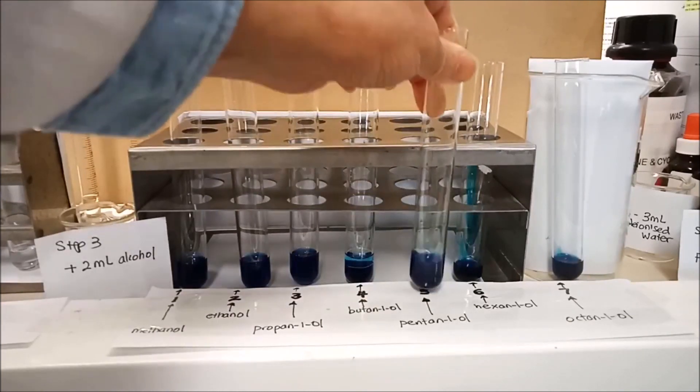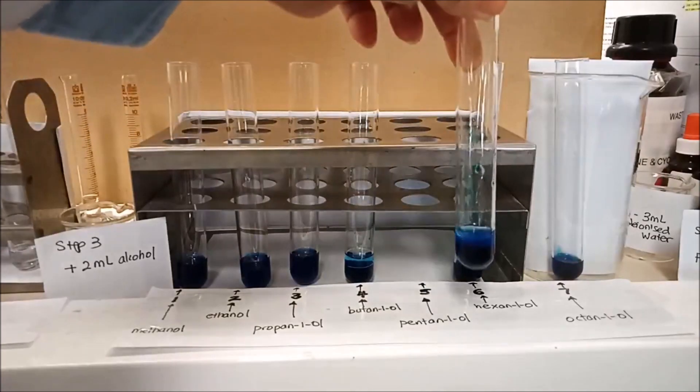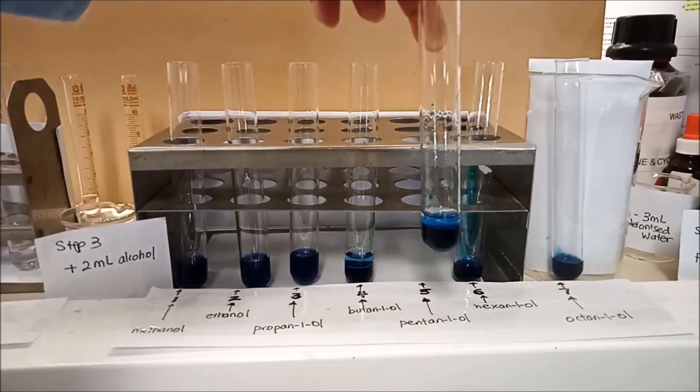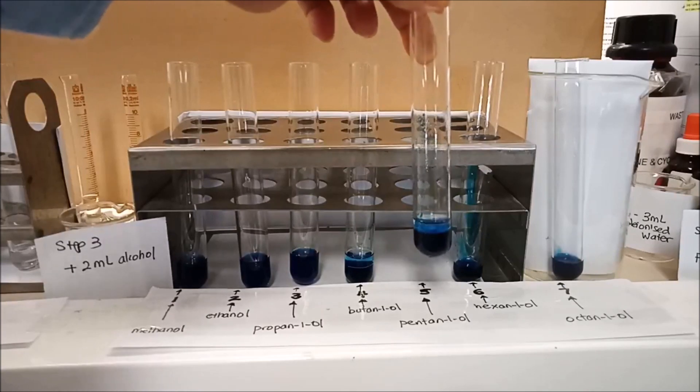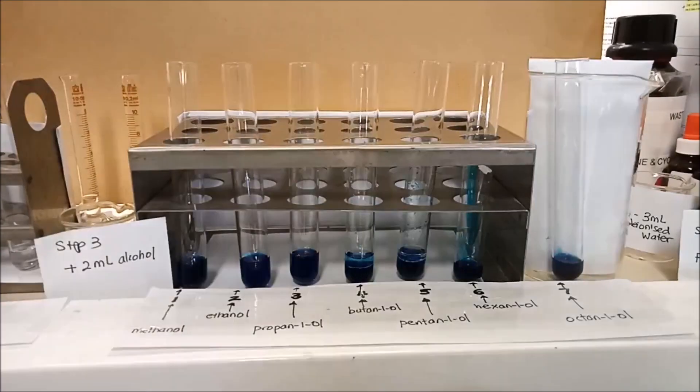You can see there are two layers there sitting very nicely on top of the water. Give it a little bit of a shake and see what happens. You can see the light blue. The light blue is actually our pentanol. And the dark blue below, the second layer at the bottom is actually water.